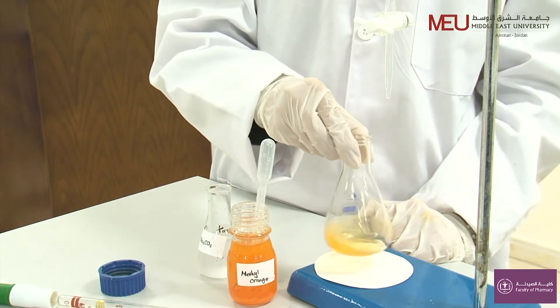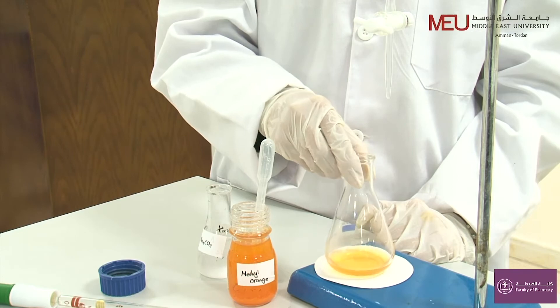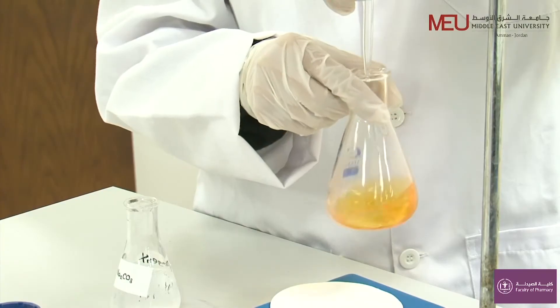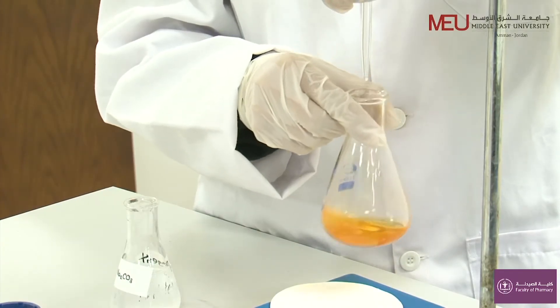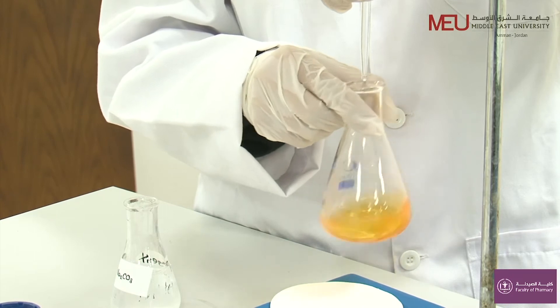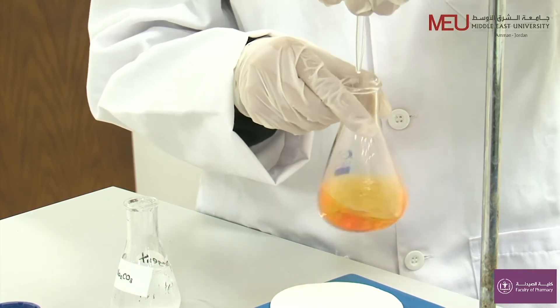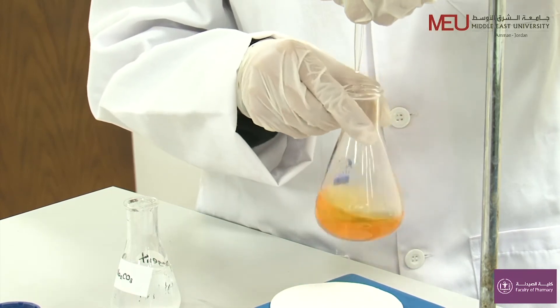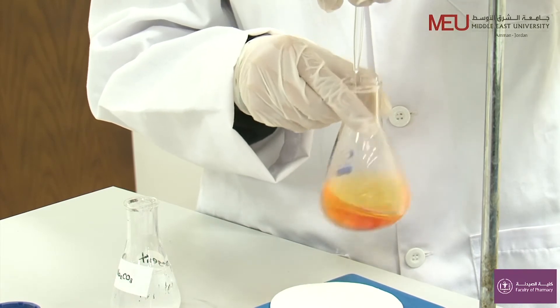And now, I'm ready to start my titration. I just go drop by drop. You can see that the red color appears and quickly disappears.